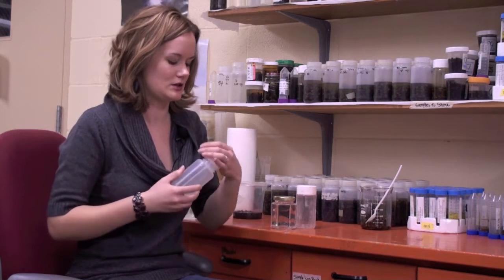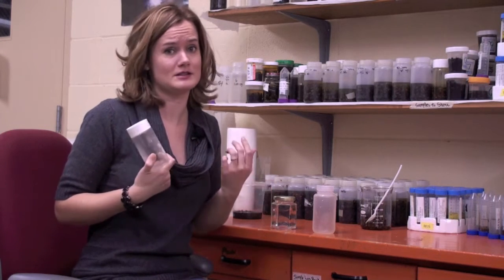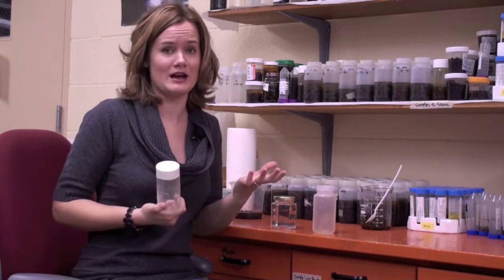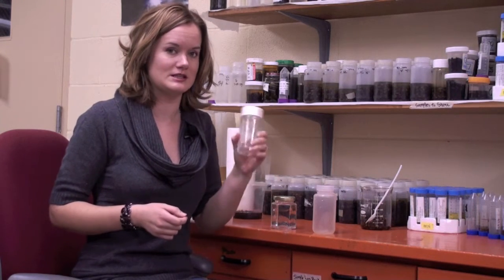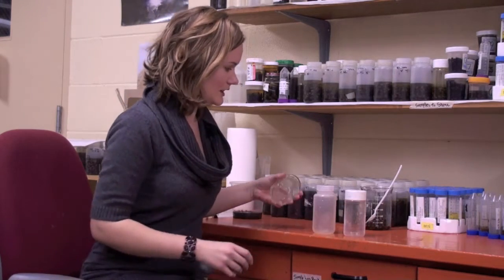Okay, next we're going to talk about the most efficient way to send samples to me. So I have 3 examples here of great bottles or honey jars that you can send me your bees in. So this is just a simple Nalgene bottle, and that's always good. And this is actually a makeup container, and this is fine too, as long as the bees can fit into it, and it's easy for me to get into, and it's airtight. And like I said, you can use a honey jar as well because it's airtight.